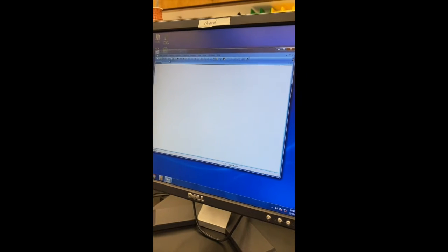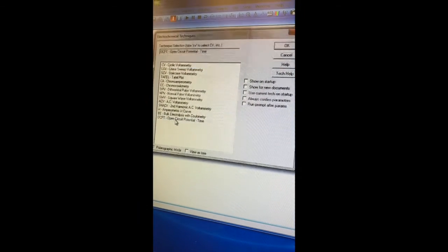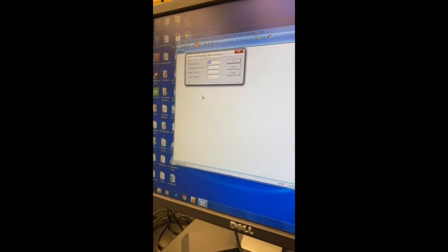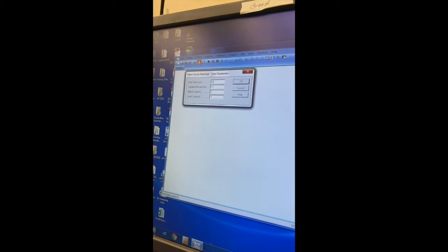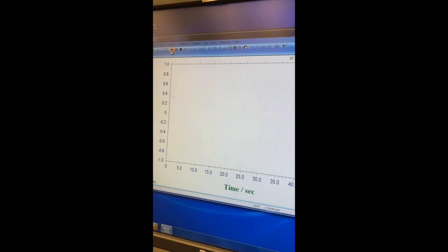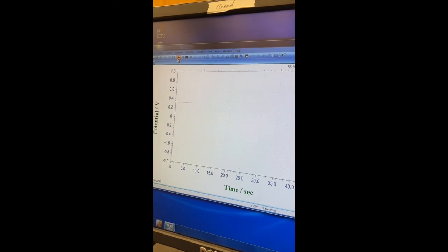And we're going to begin by running an OCP. So I'm going to click on this T up here. And I'll see OCP, open circuit potential at the bottom. And we're basically going to run this to find the equilibrium voltage of the cell. So I'm going to do this for a minute. So I'm going to type in 60, click OK, and then press go or run. And this should appear like this. And you'll see it tracking across the screen.